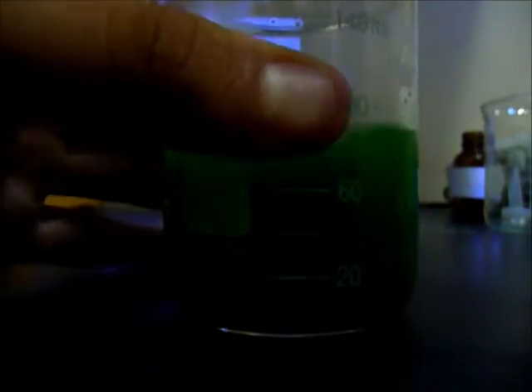And you keep that stirring and stirring, and you see that the solution turns to a green color, which is copper chloride.